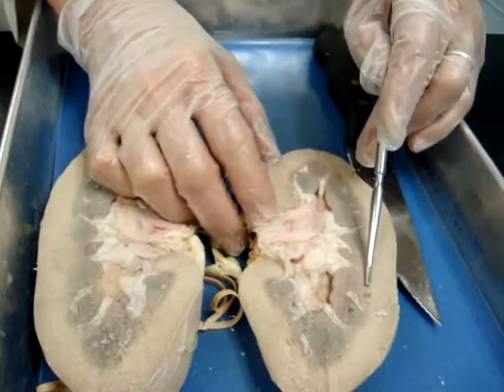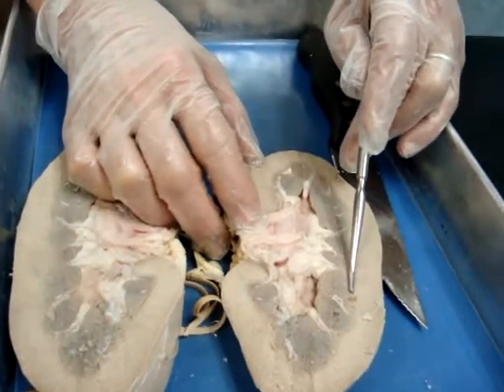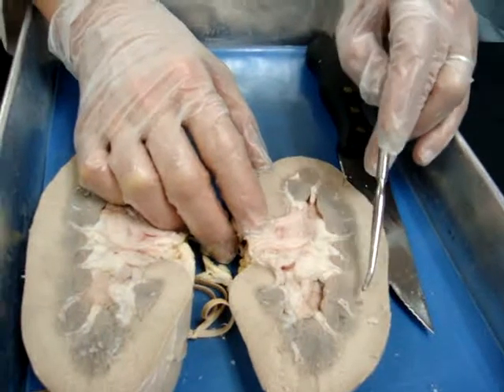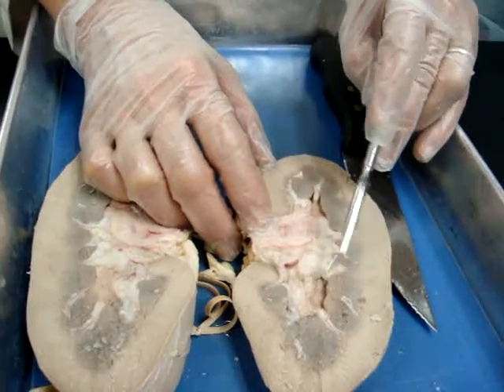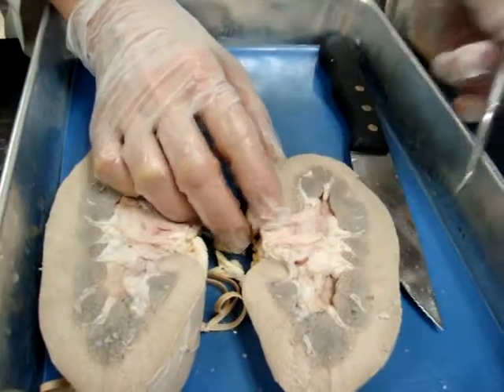This is then what? Cortex. If I said from here to here, that's what? Medulla.